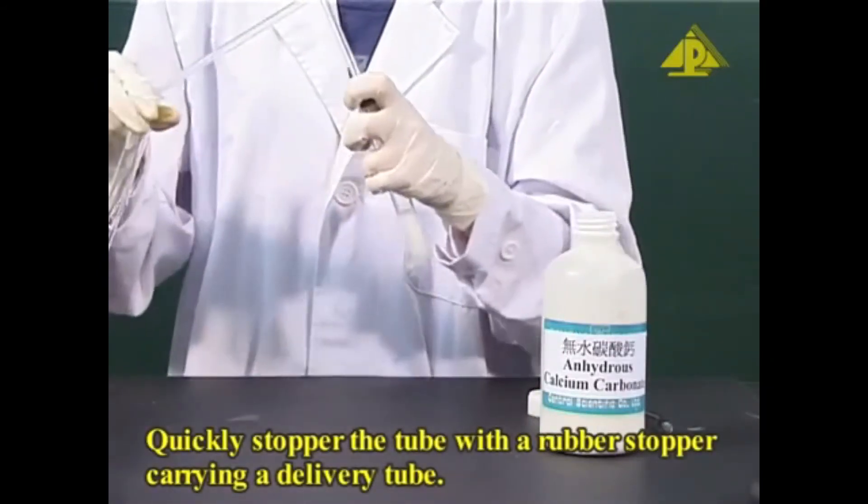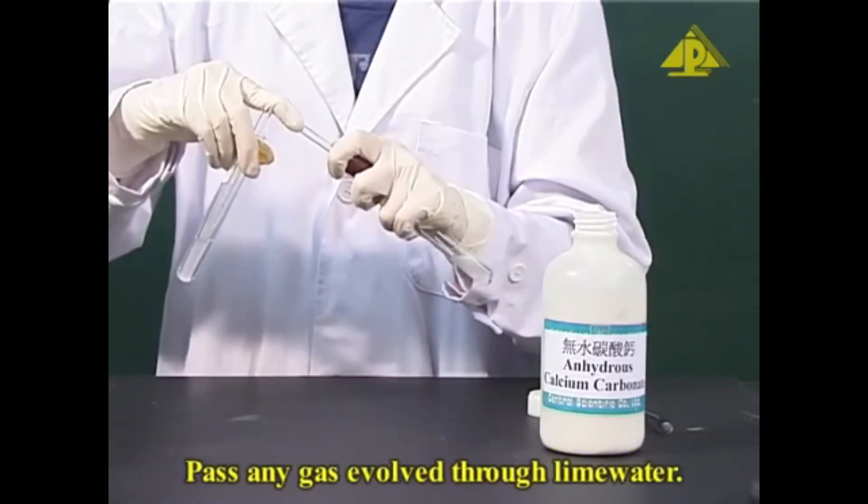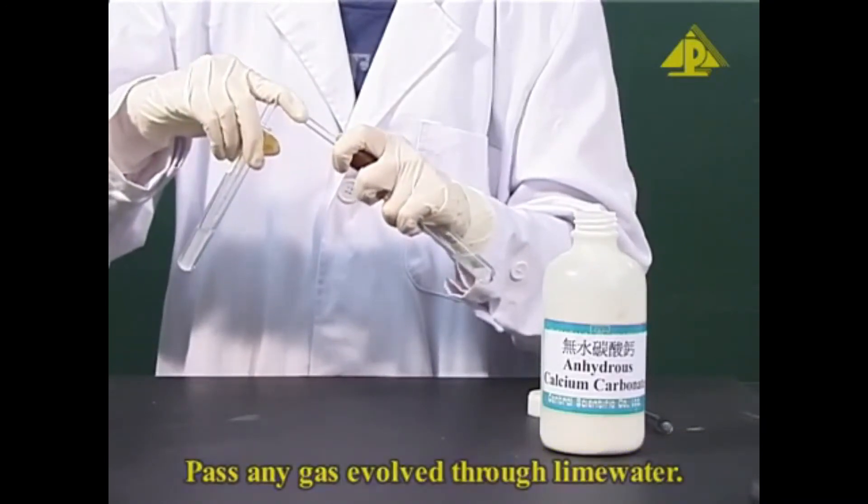Quickly stopper the tube with a rubber stopper carrying a delivery tube. Pass any gas evolved through lime water.